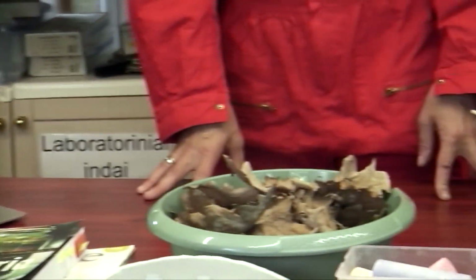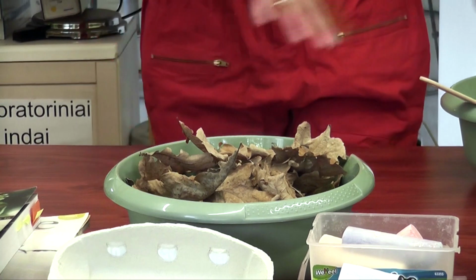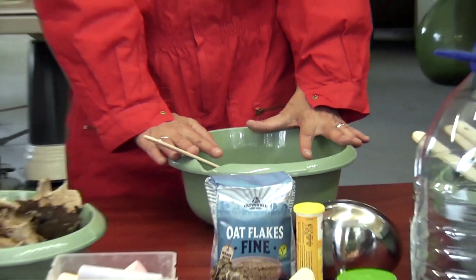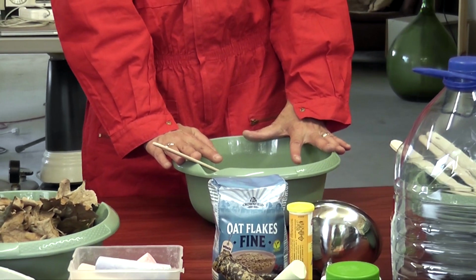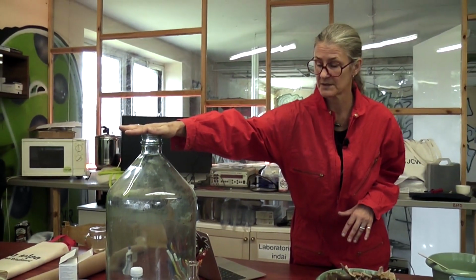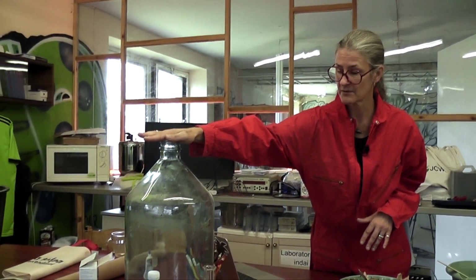So that's our second step. So we do all of the mixing. Then the third step is decanting. So for our columns to thrive, we need containers. So we will decant into containers. This is an exceptionally big and beautiful container. We're going to do a massive one.